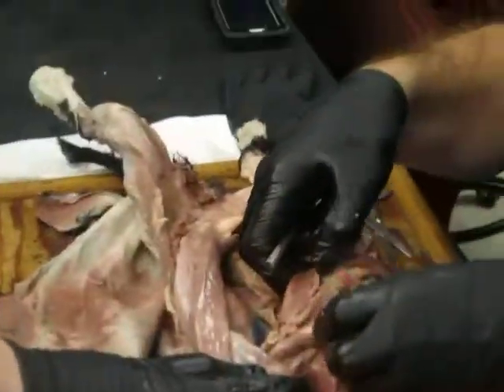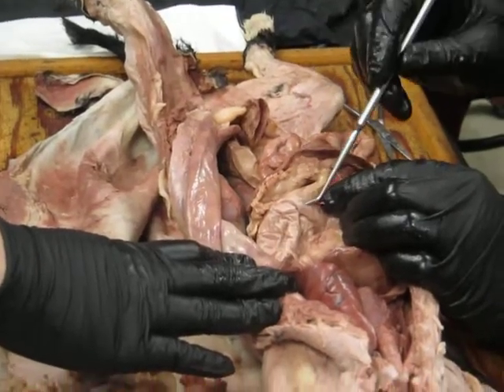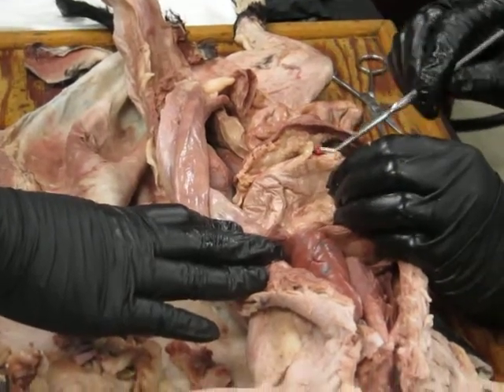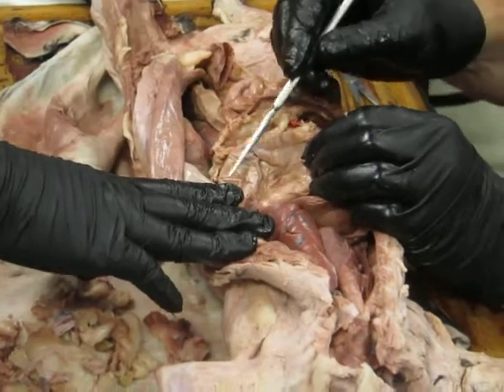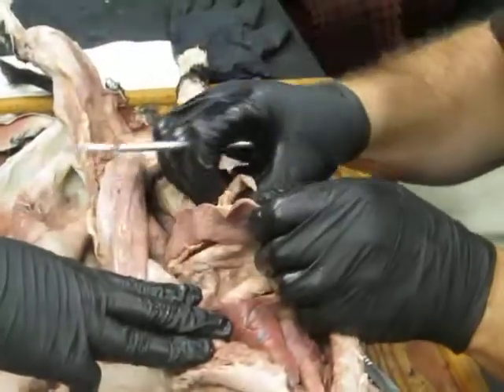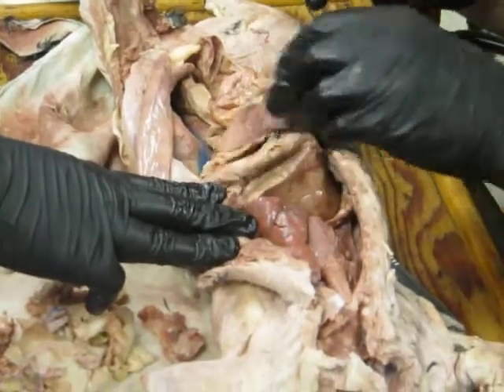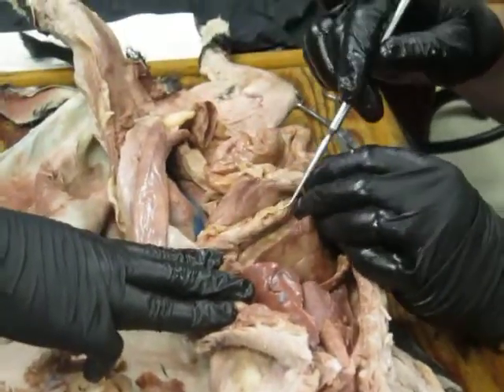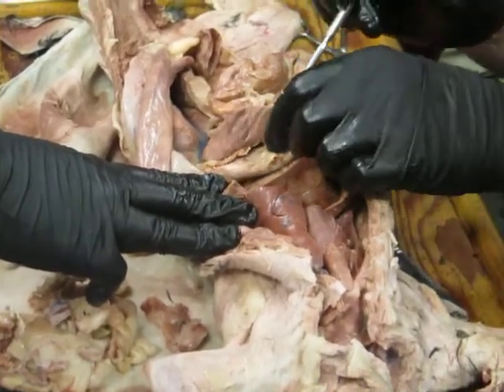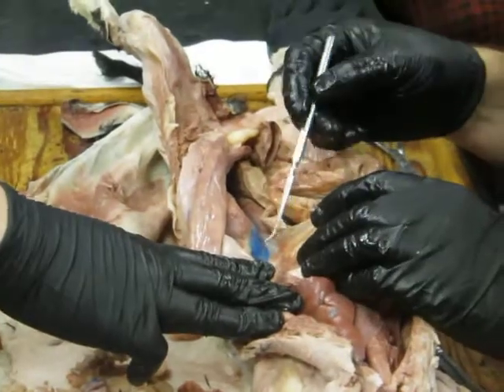Okay. And it's sort of torn through a bit here, but there is a mesentery that connects the spleen to the stomach, which would be the gastrosplenic ligament, yes. And that's part of the greater omentum. Remember, the greater omentum is the mesentery, the dorsal mesentery of the stomach. And in mammals, what the greater omentum does, and it's so easy to see on this particular animal, is it comes down off the greater curvature of the stomach and attaches to the spleen, and then comes and wraps around the back side and runs down and connects to the dorsal body wall.